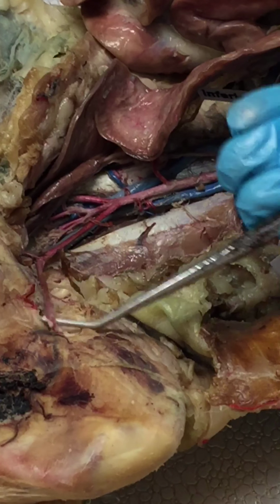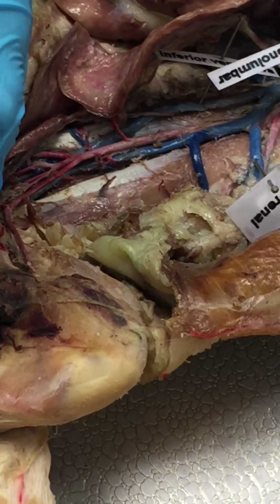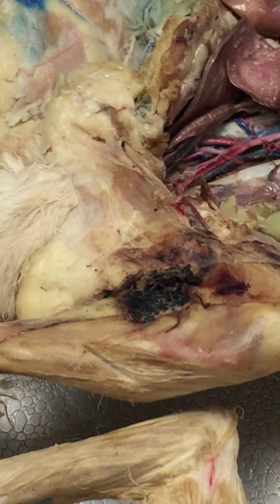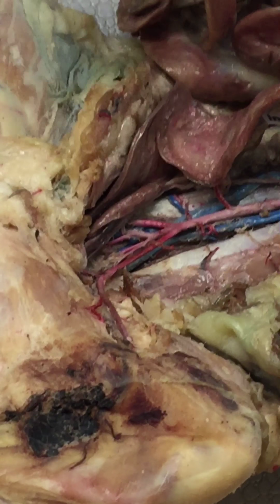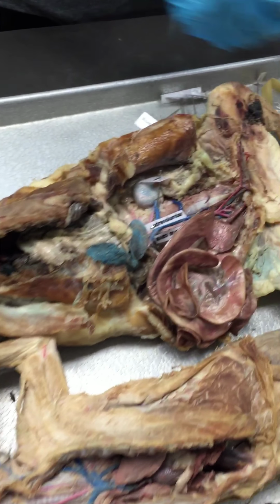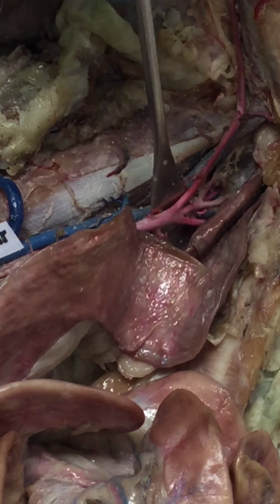We just haven't dug it out yet, but that's the femoral iliac? No, that's just femoral. Just femoral. Yep, there is no iliac after the femoral. The femoral artery or the femoral vein. Okay? Femoral. I guess femoral would be the actual correct pronunciation. Femoral artery. So, yeah. So, move these veins.